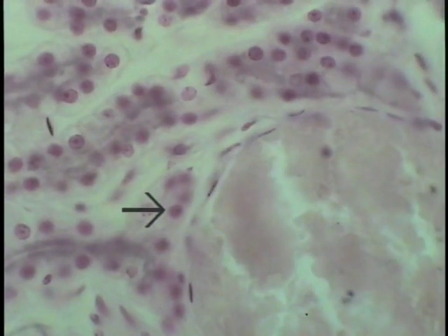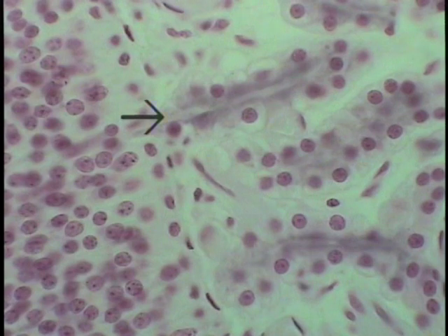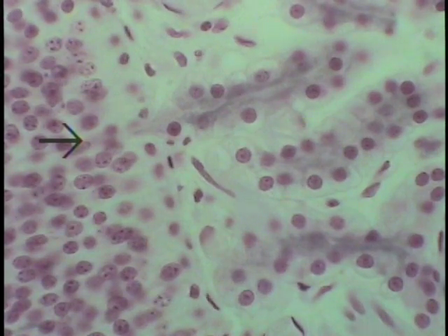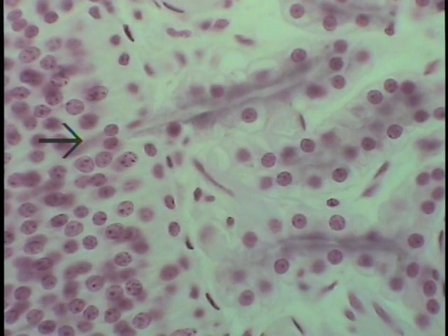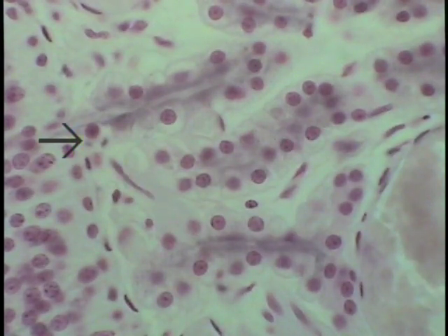The venous sinus, or a portion of the wall of one, is shown here, and even at this point, where the arrow indicates, you can see the gland and its forming duct actually entering into the olfactory epithelium to course to its surface to put its secretion on the surface or release it there. So these are the high-powered view of these rather strange olfactory glands, and there's nothing else that I am aware of, at least, that look quite like them anywhere else.